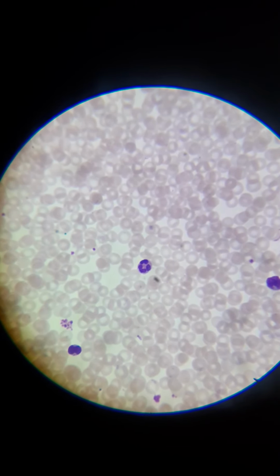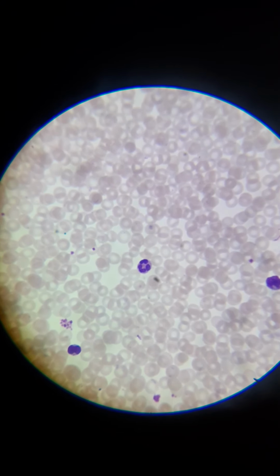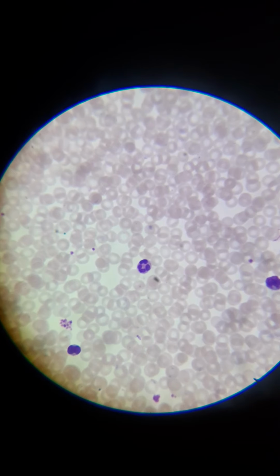But that is a neutrophil, and neutrophils are actually the primary cell that comes into inflammation, or when you have a bacterial infection or anything that needs to be fixed. They come in and phagocytize, or engulf, the harmful substance, and it gets rid of it. And actually, kind of interesting, pus.